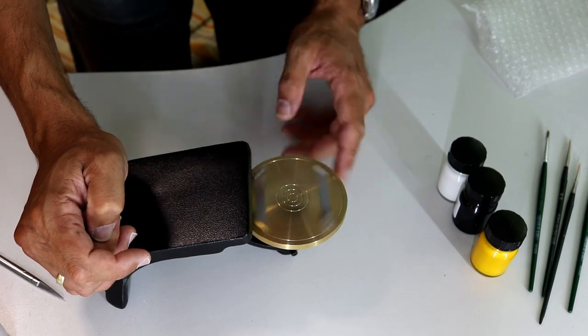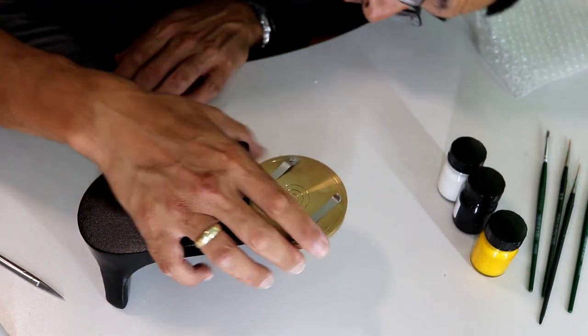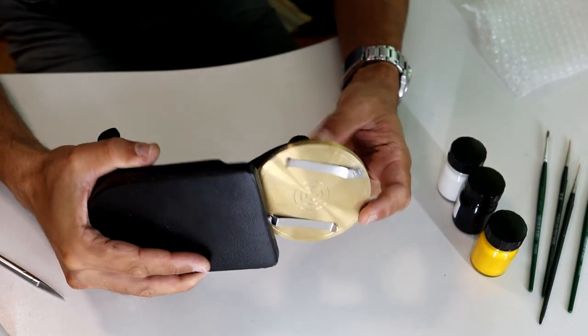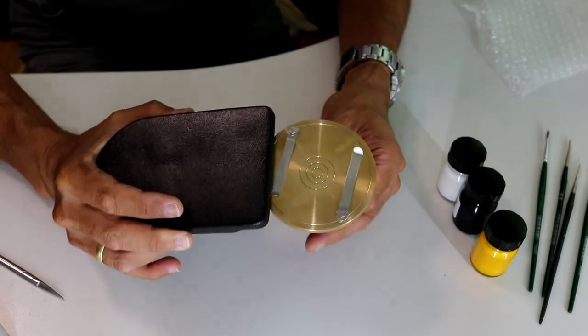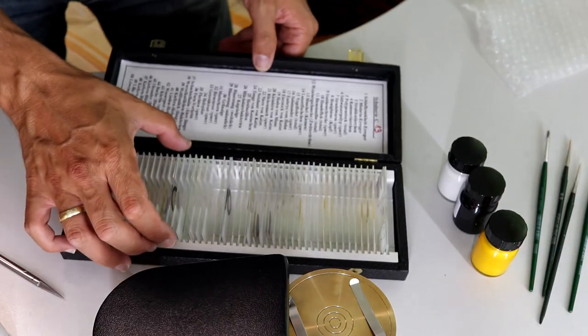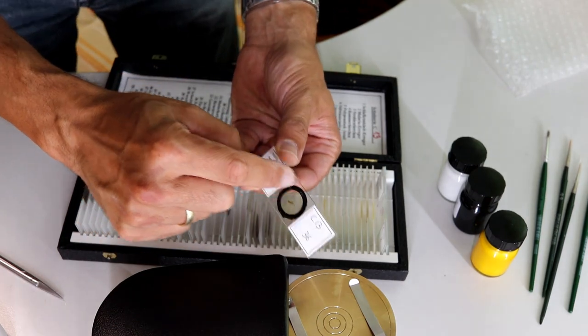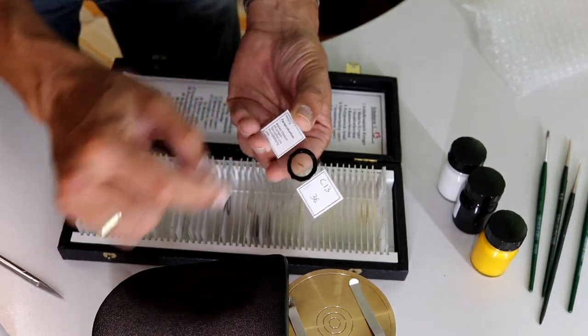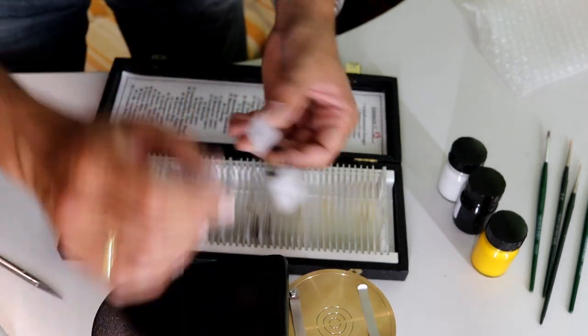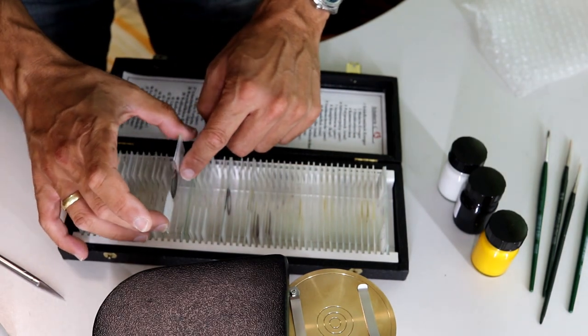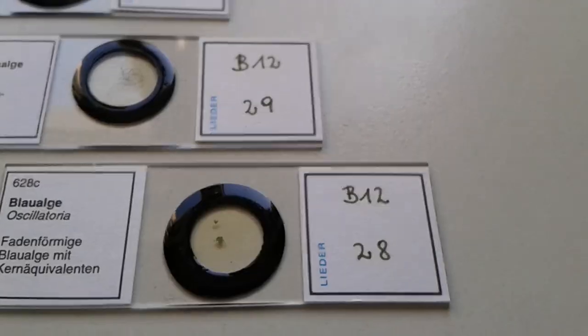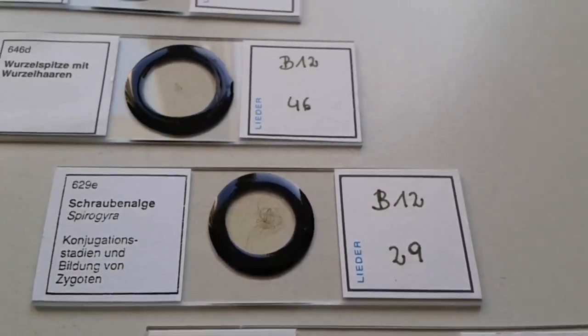This is the turning table, and the black large thing on the left here is the hand or arm rest, because you need to stabilize your arm when you apply the paint. This is basically an example—this is what I want to make. This is a ringed slide. You basically make this by putting a slide on the slide ringing table and then applying paint with a brush.